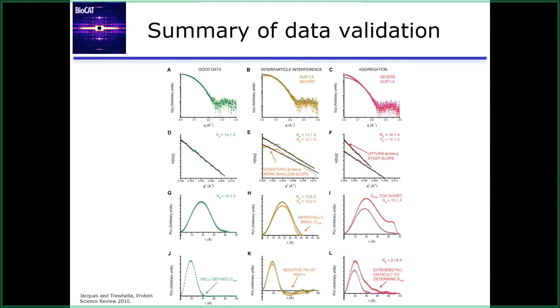This is the same plot that Kushal showed from that Jacques and Trewhella 2010 paper. This is a very good resource for seeing a lot of the effects that we just talked about, and what effects they have on different portions of your profile. They have good data on the left-hand column with a Guinier, a P of R, and then a P of R where they've extended the Dmax. They have interparticle interference in the center column, aggregation in the right column. So you can see the effects on the Guinier: you see the downturn and the Rg goes down, or the upturn and the Rg goes up for interparticle interference and aggregation. In the P of R, we truncate the P of R, or we have to artificially force it, depending on which one we're looking at.